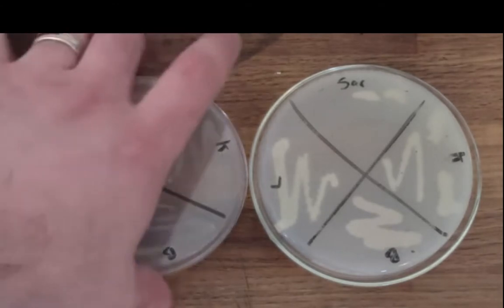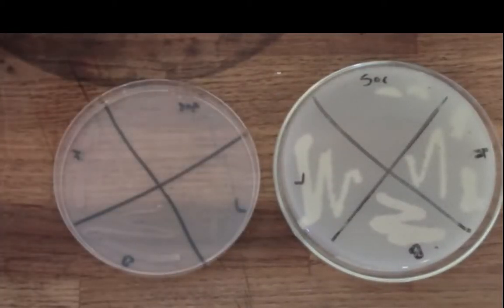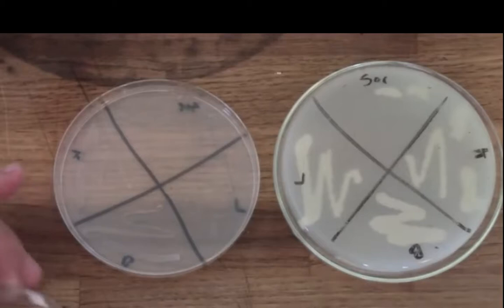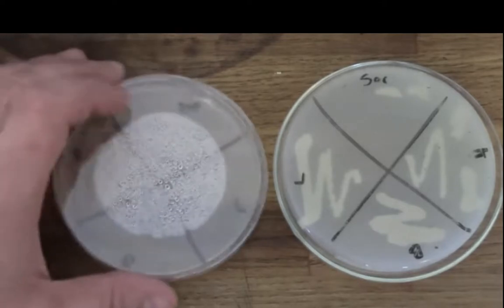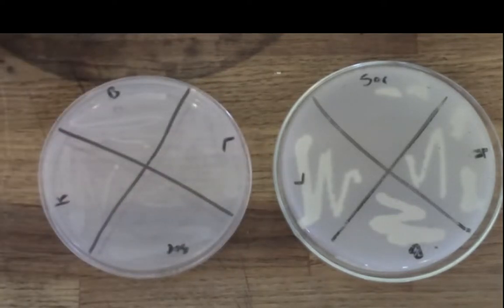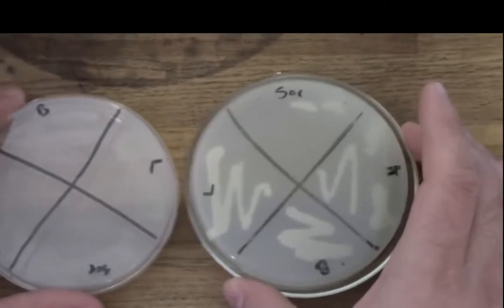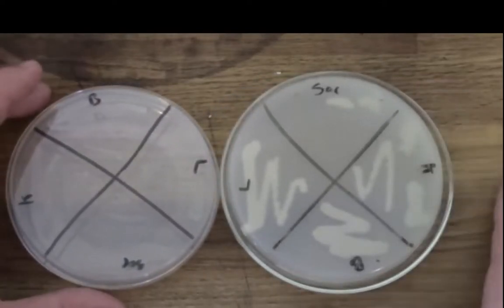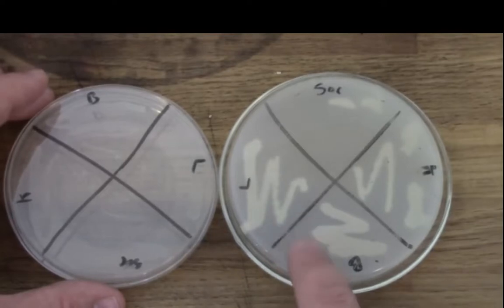So I'm just going to flip this plate over here so you can get a better view of the growth. And I think what you might appreciate is that while there is growth on each quadrant, the growth isn't that intense, it isn't that thick or florid. So these plates do work really well for growing these organisms, but the growth is somewhat slow, and it's not quite as aggressive as we might see in other plates. And I think you can appreciate that just by looking on the top side at the potato dextrose agar plate here, which if you recall I cast on the glass plates.